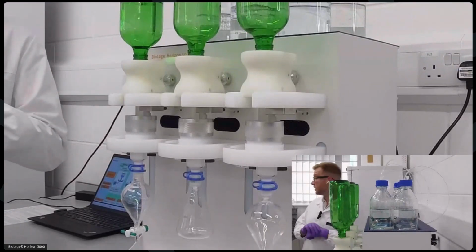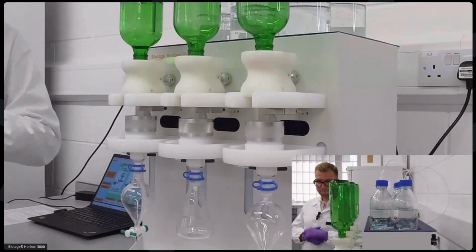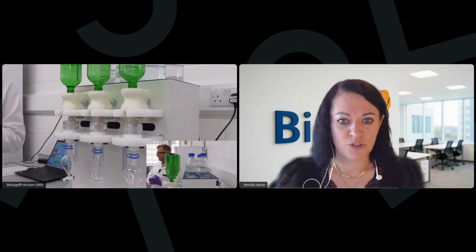And whilst the samples are loading, we can have some more questions if anyone has any. Sure. So there was a question on EPA 625.1. The lab is looking to transition from liquid-liquid extraction to SPE and would like to have any helpful information to assist with the process. I believe that's something we already have an application note for.